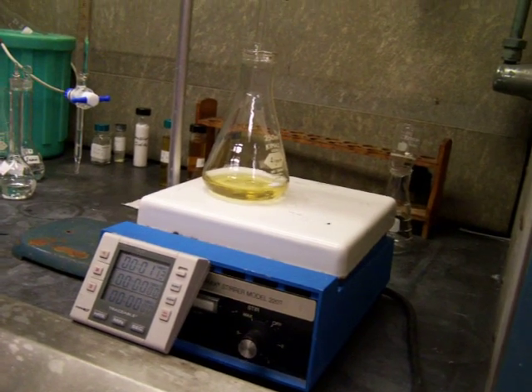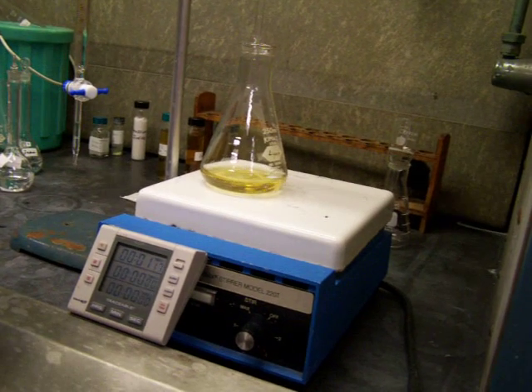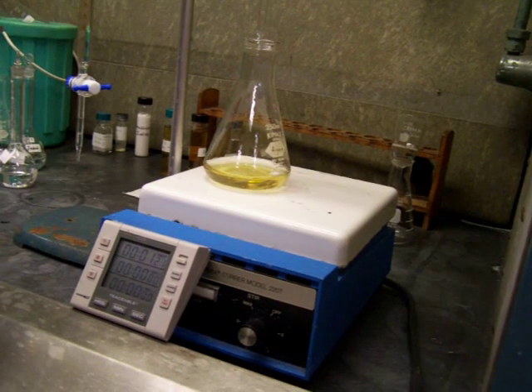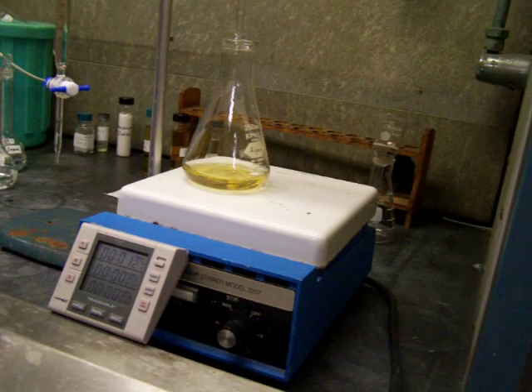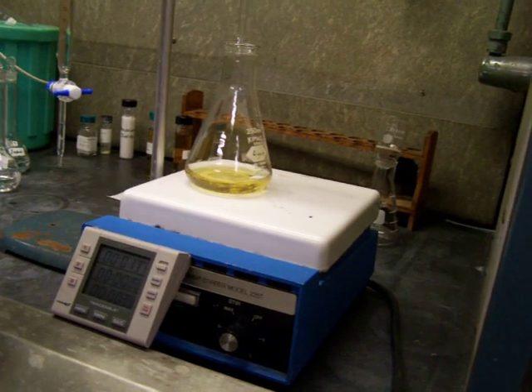Whenever you hit the 10cc, where's the 10cc going to be? It started at 32.6, so it's going to 42.6. Okay, I see that. 42.6? Are you sure? I see 42.1, the black mark there.